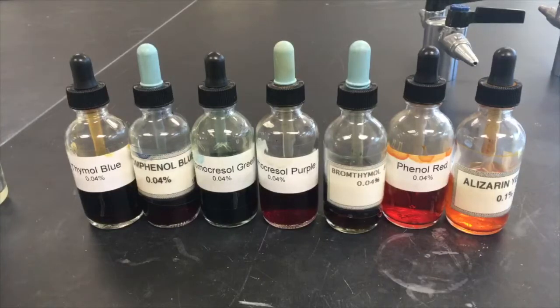Hello, this is a short video for data collection of the pH by indicators lab in Chem 104. I just wanted to show you a little bit about how we're set up here.